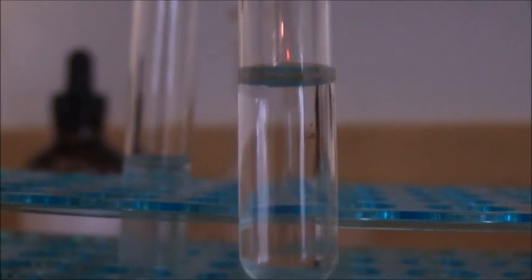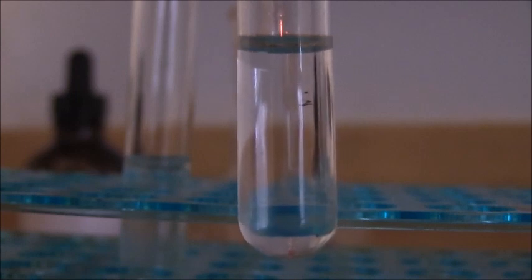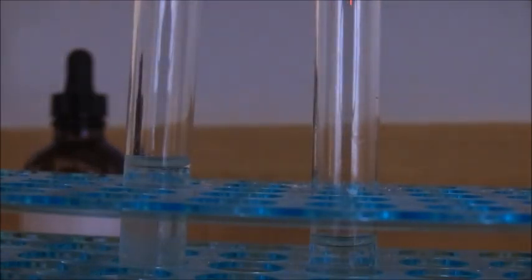And this is our experimental solution, which just contains ammonia right now. We're going to add some of our experimental solution to the ammonia, and then we're going to add several drops of silver nitrate. And if we have created purines, what you would expect to see is a cloudy white precipitate, which very quickly turns to a light brown color, and it settles out as a light brown precipitate. And so now we're going to test these. So we're going to take our solution and add it to our experimental test tube.